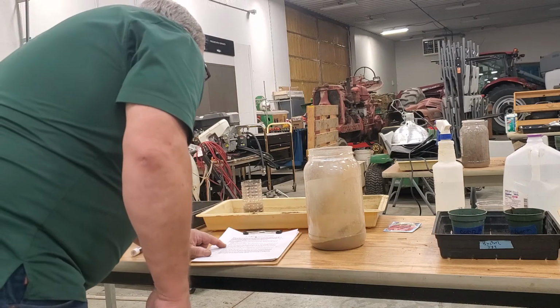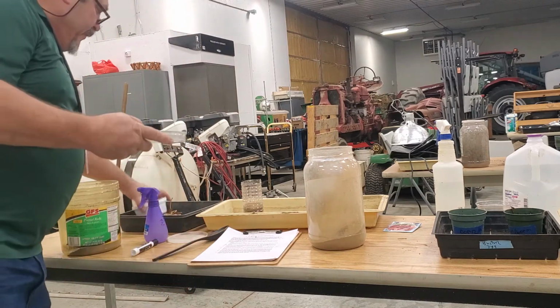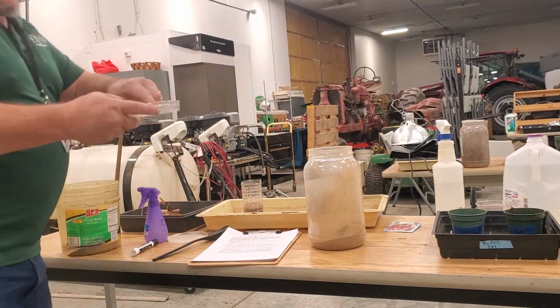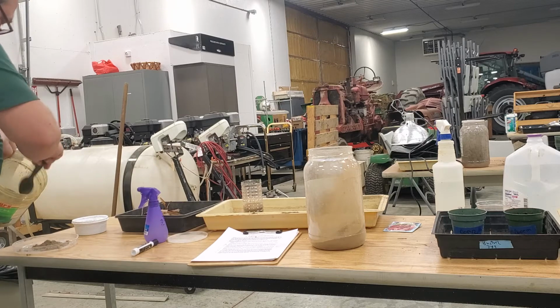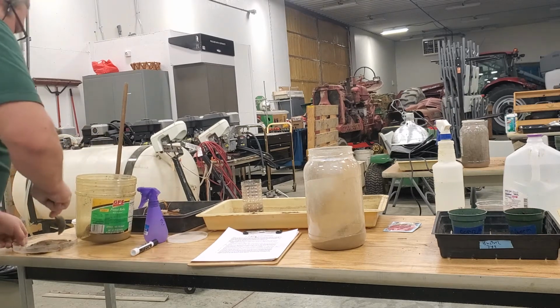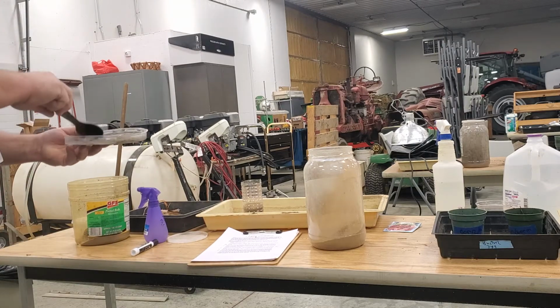And then it says mix a small amount of food. Okay, my small amount of food is I just went right out the door here, and I got some leaves, and I've got some grass shavings here, and I shredded them up. So I know that my topsoil that I'm going to use here has a little bit of food in it, so I'm going to mix those two together. So make sure there's something for those critters to eat.